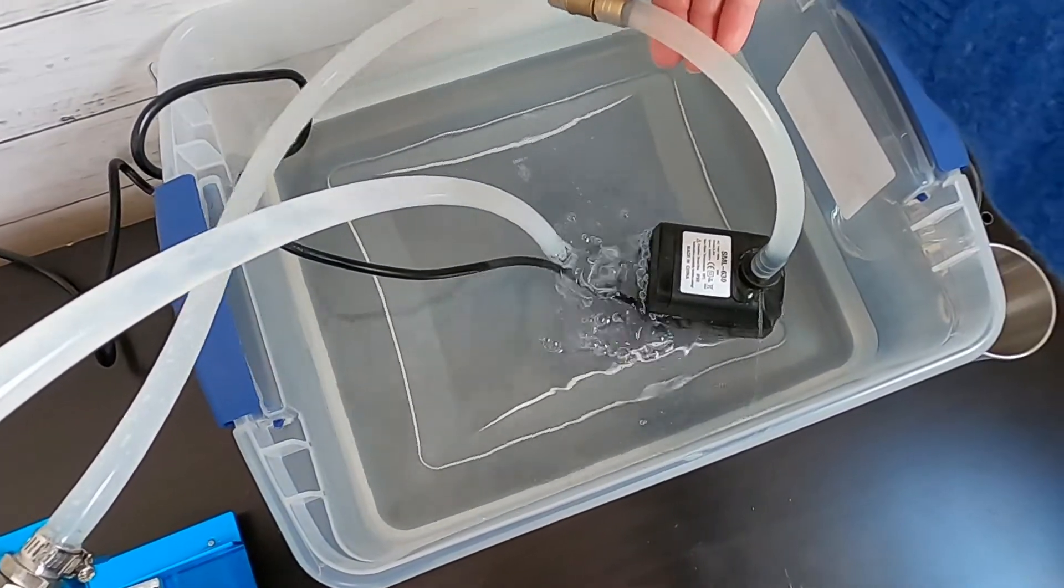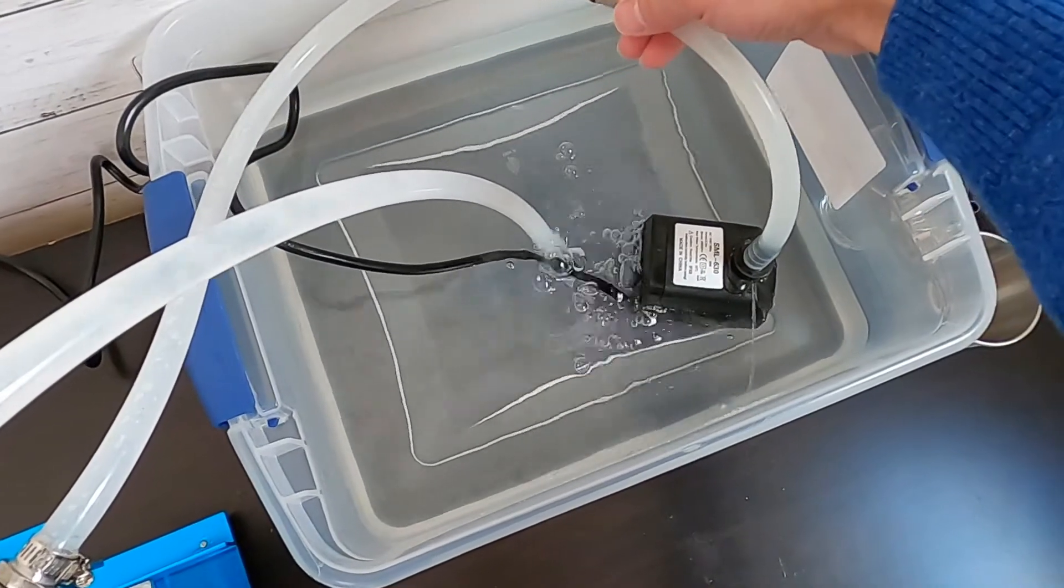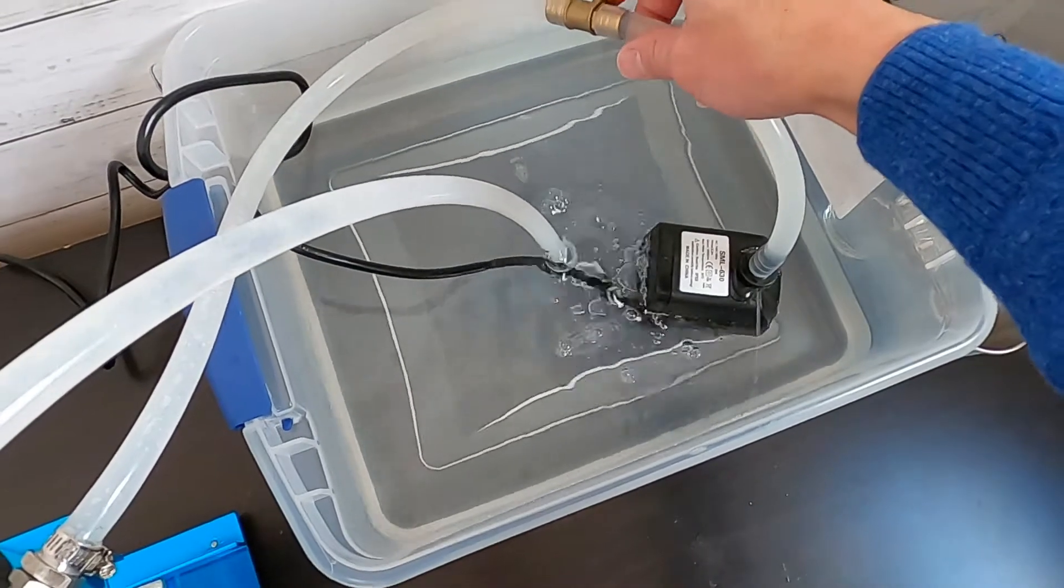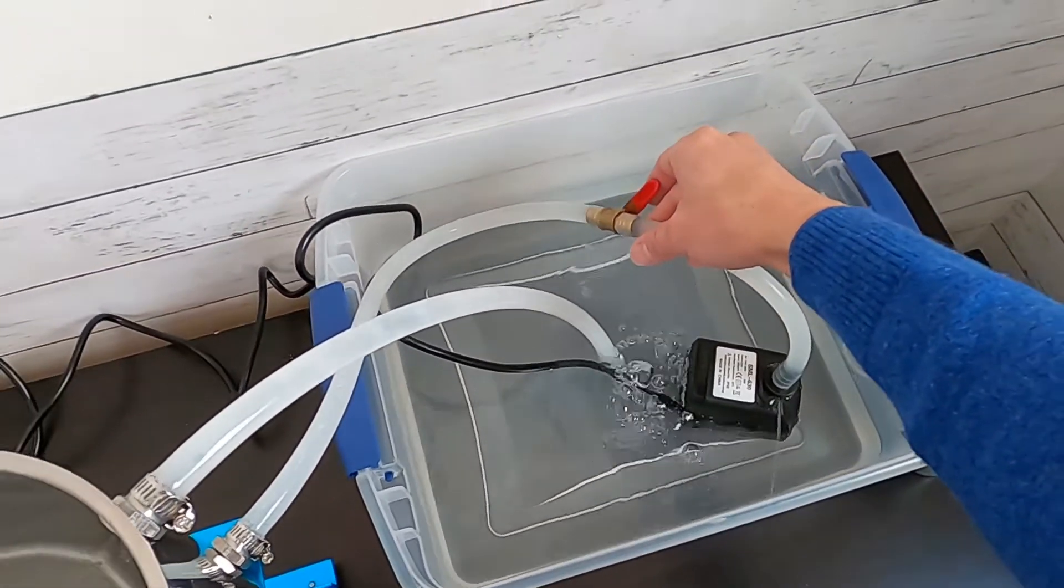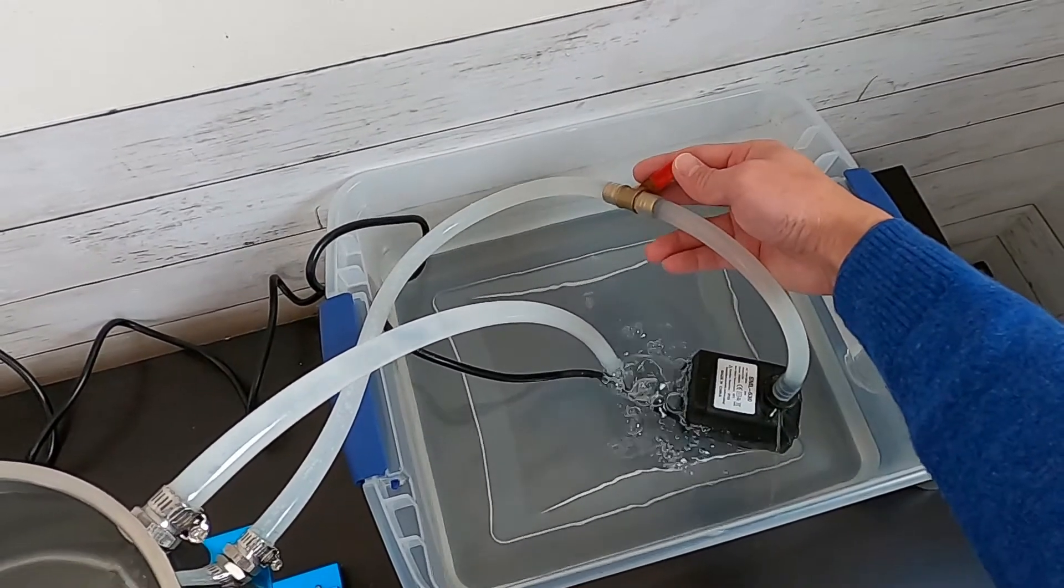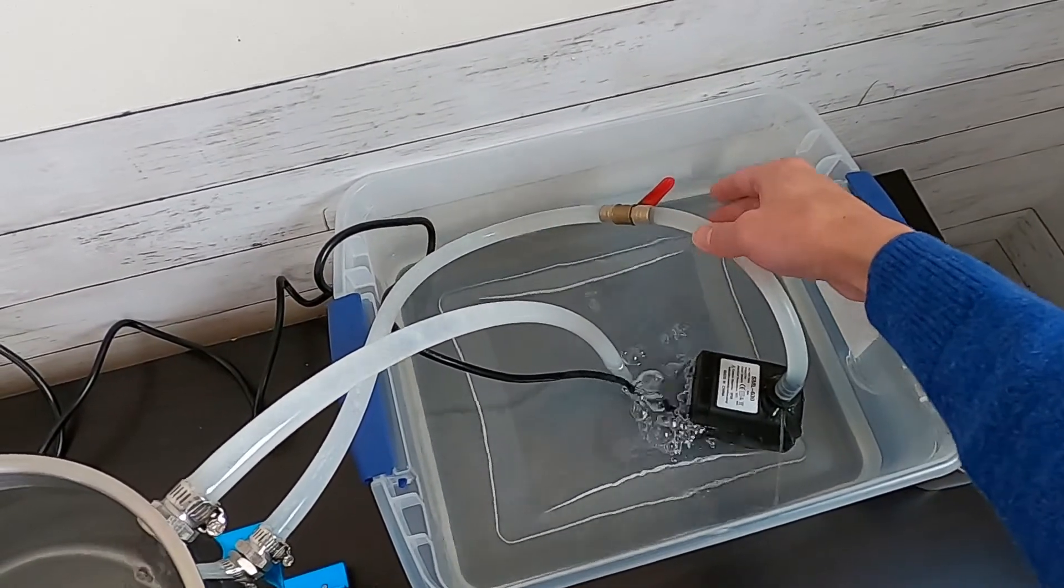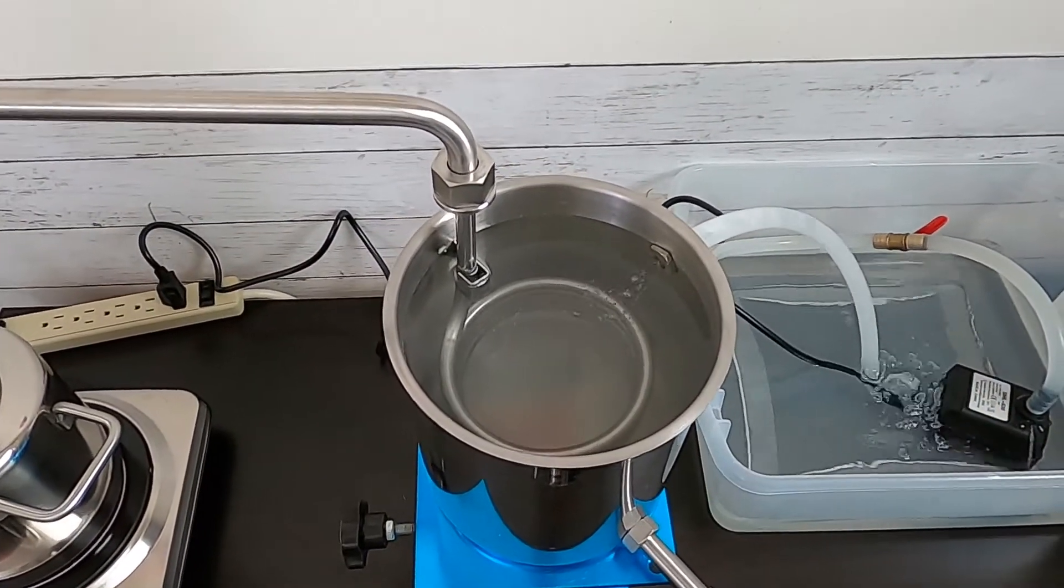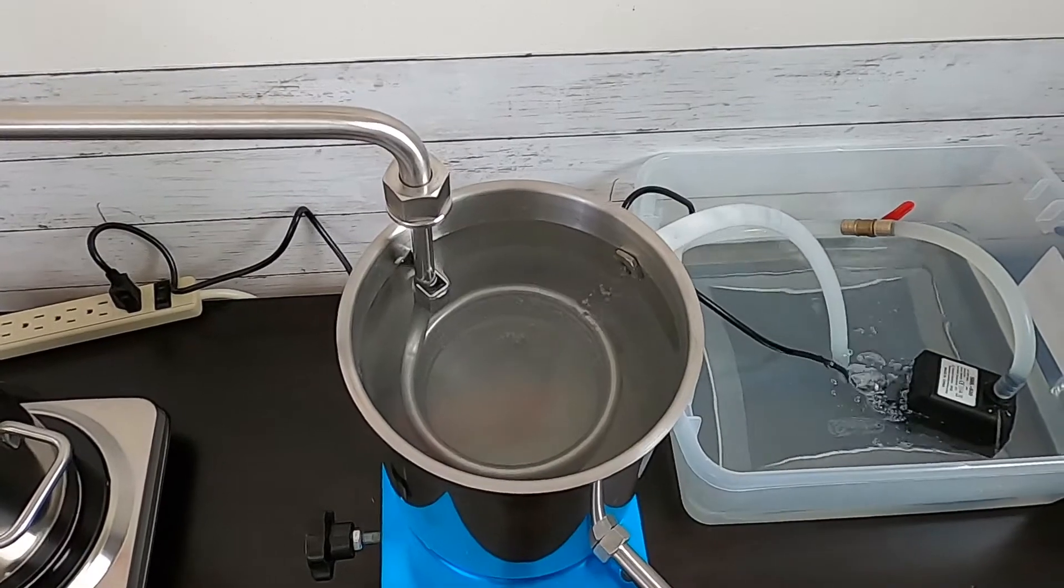You just go to the perpendicular position. If you go to fully 90 degrees, that means fully closed. You just close a little bit. Make sure the level, the flow is good to keep the levels stable and no overflow.